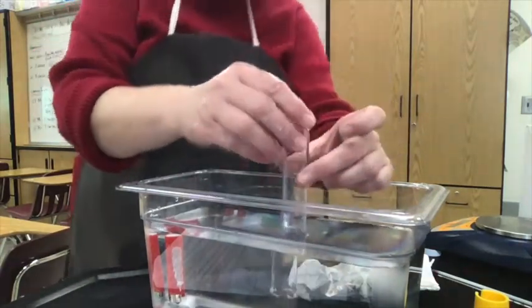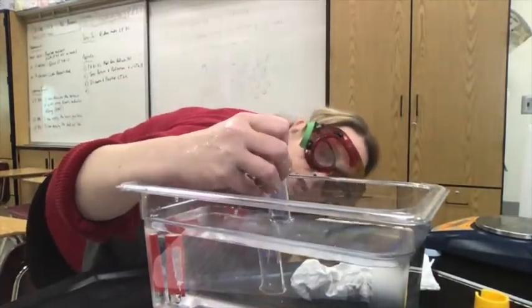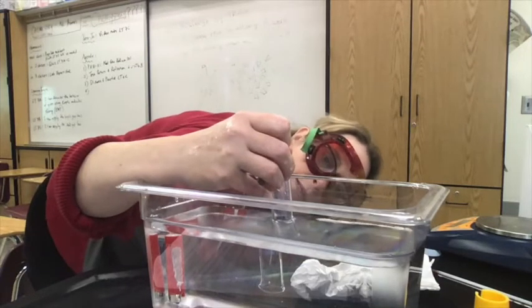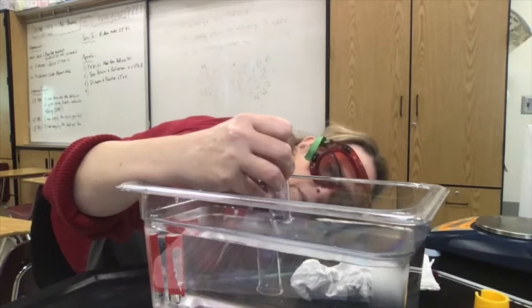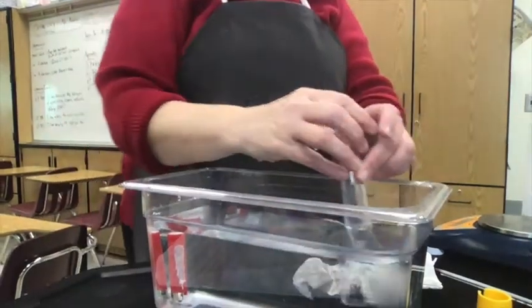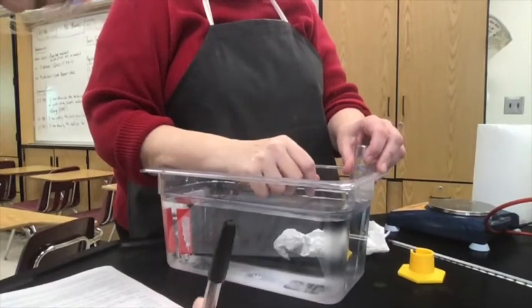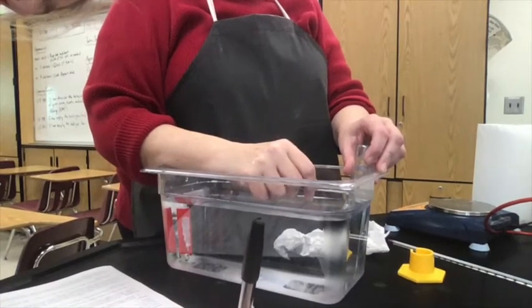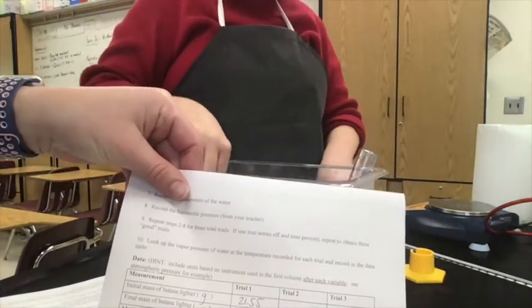So I'm going to come on over here and read it. It's kind of hard sometimes to read it upside down and to the tenths, but we'll do our best. And it looks to me like it's right at 44.0. So 44.0, reading my graduated cylinder correctly to the tenths, is going to be in milliliters. So we fill that in right here on the data table. Volume of butane collected in milliliters is 44.0.